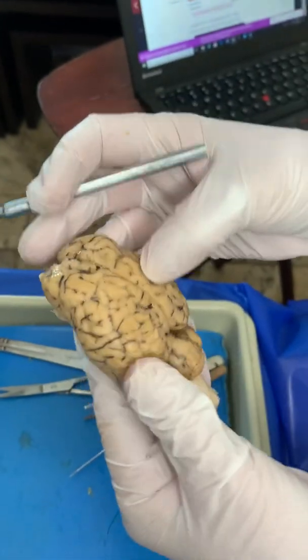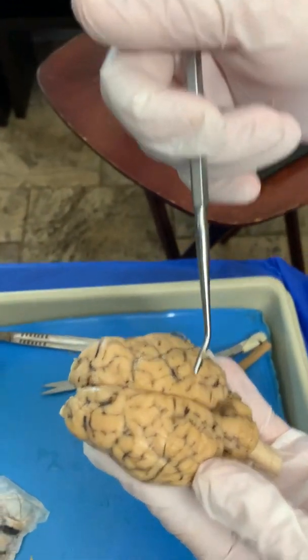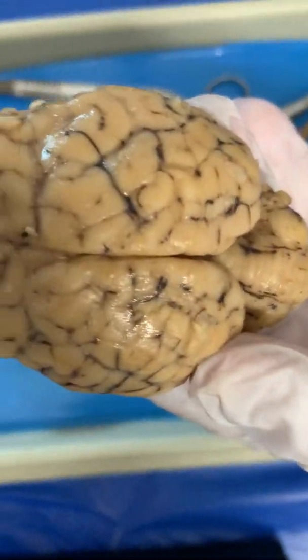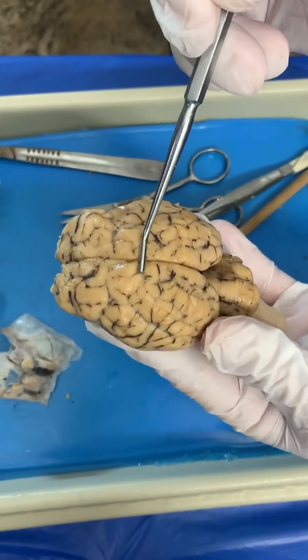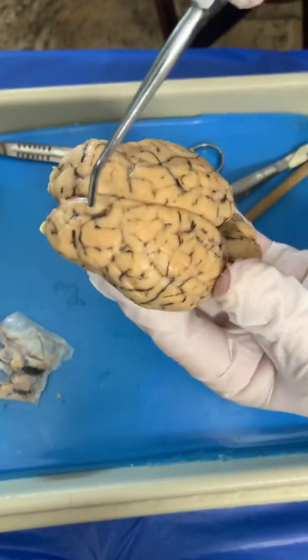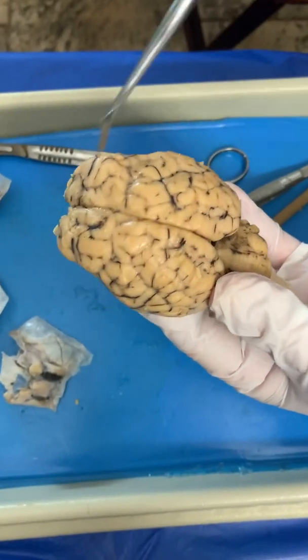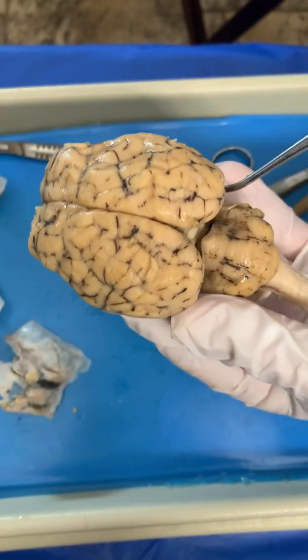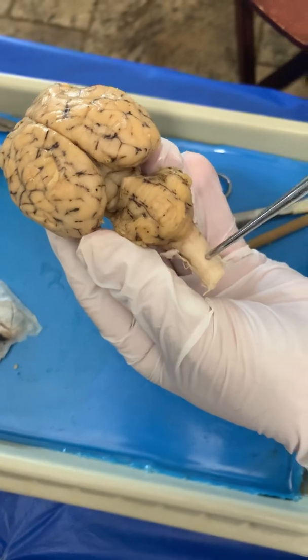All right. So again, the frontal lobes go right on top of the brain. I don't want to see this in the back. When it's on top: frontal lobe, parietal lobe, occipital lobe, temporal lobe, central fissure, parieto-occipital fissure, longitudinal fissure, lateral fissure, transverse fissure, cerebellum, vermis of cerebellum, and spinal cord.